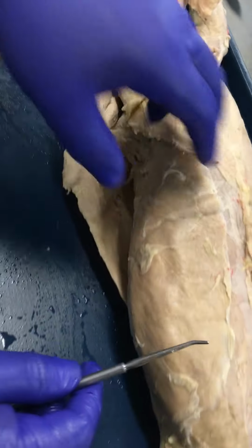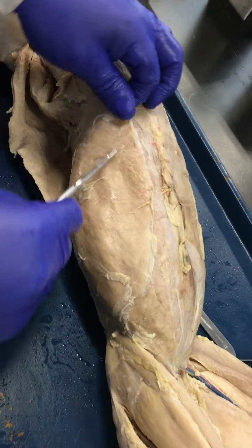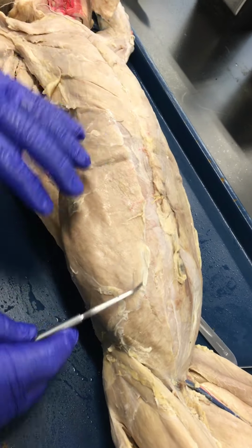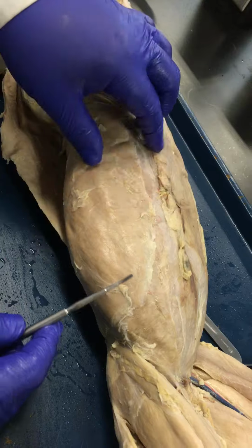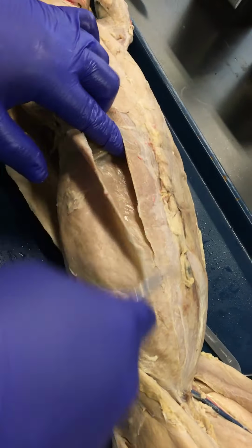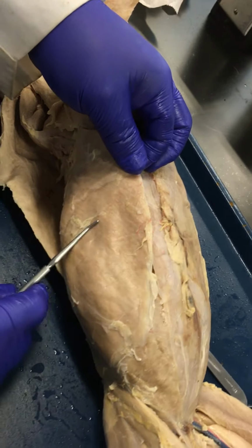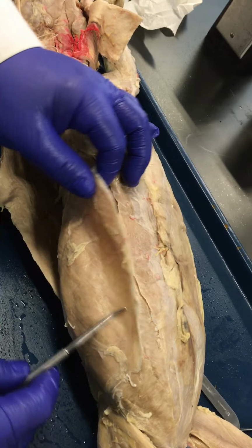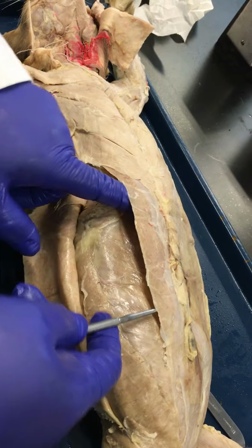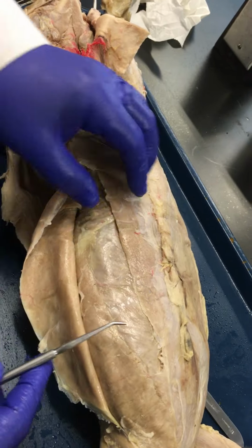From there, we move down to the abdomen. In the abdomen, we're going to have four muscles. Two of them are superficial. The first one, the most visible one, is going to be the external obliques, kind of on the lateral aspect, and then towards the medial aspect, you have the rectus abdominis. For the external obliques, you're looking at rotation of the trunk as well as compression of the viscera. And for the rectus abdominis, you're going to be flexing the trunk.